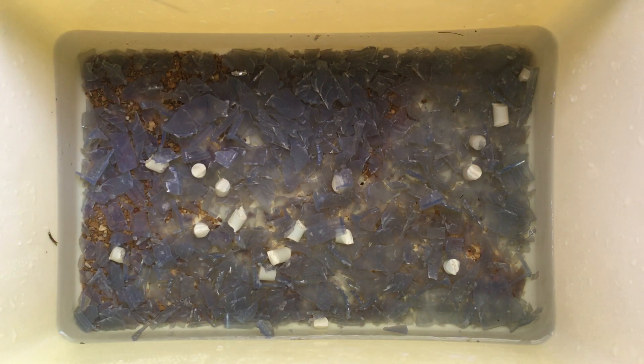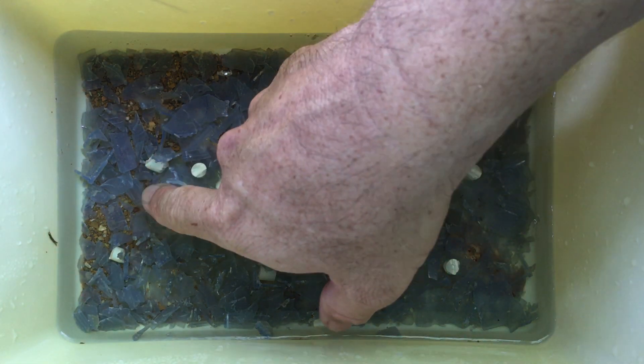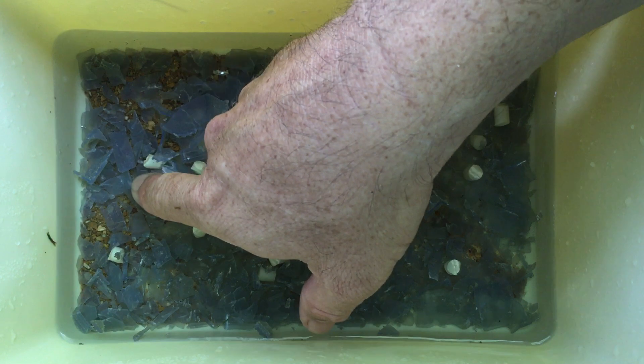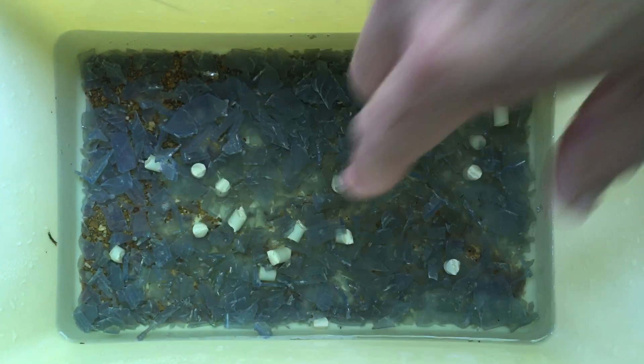We have a heterogeneous mixture of polystyrene pieces and coarse sand. Both are more dense than water, but it's a heterogeneous mixture — we can visibly distinguish the components.